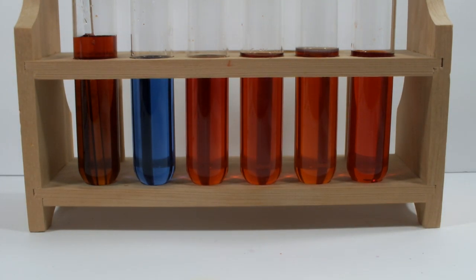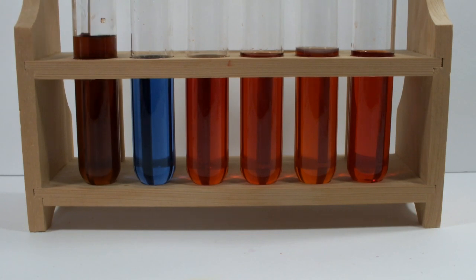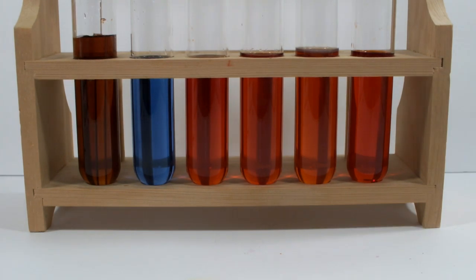I guess I'll have to add another squirt. It does darken up here, so you can see that some of the ferroin is starting to be oxidized. Maybe with a good stir we'll get that nice clear blue color. Or maybe not. I can't believe this stuff. Alright, let's try it. Is the third time going to be the charm?